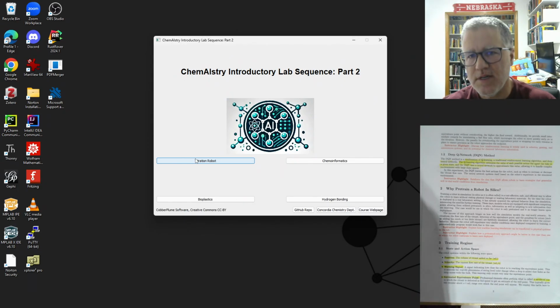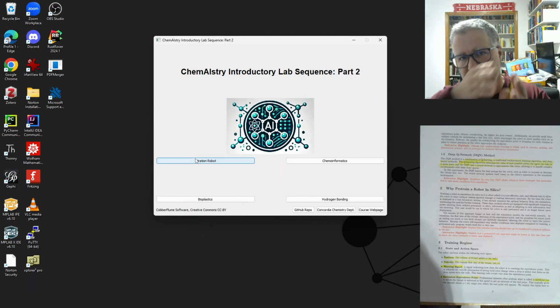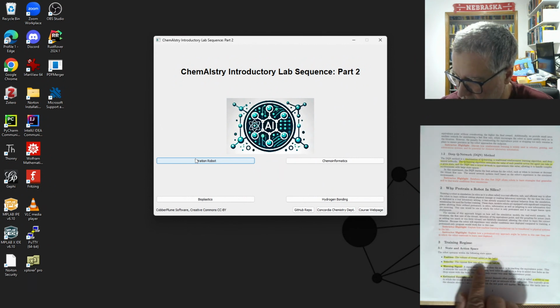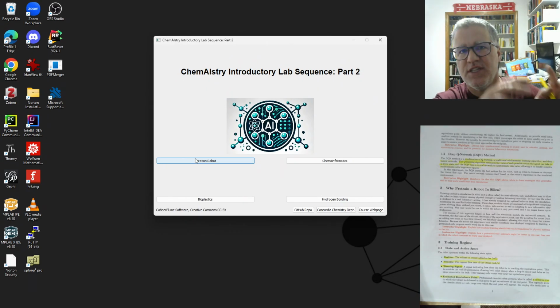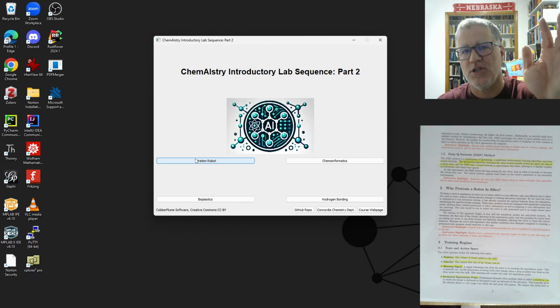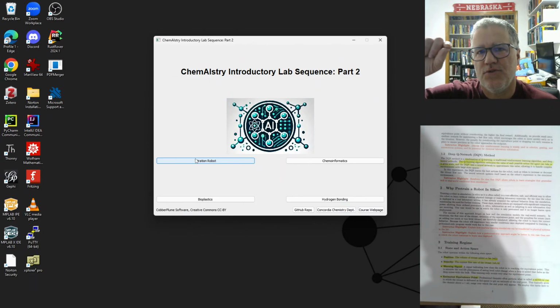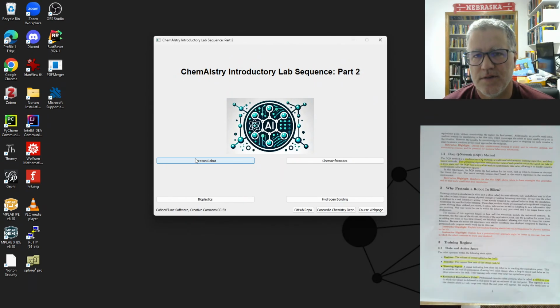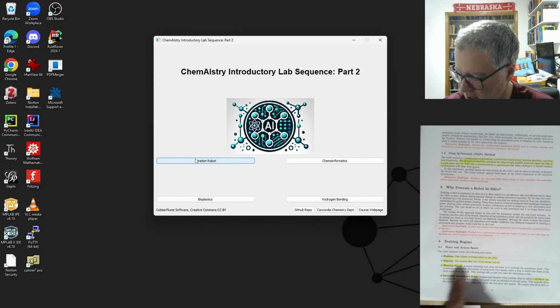So I'm thinking about this as position being the volume of the titrant, so our position along that volume added line. And then the velocity is how fast we're adding titrant. So when you see the graph here, we're going to actually see volume of titrant added versus time. Because yes, we could have the robot come to right before the endpoint, but if it takes 3 hours to do that, it's not a very useful thing. So the velocity is important here.